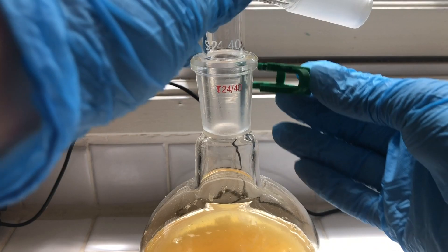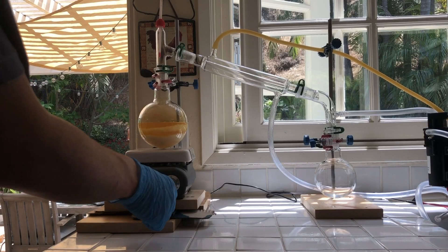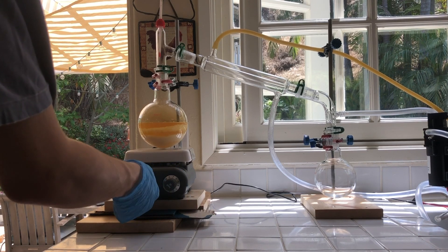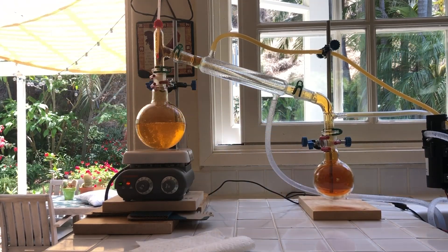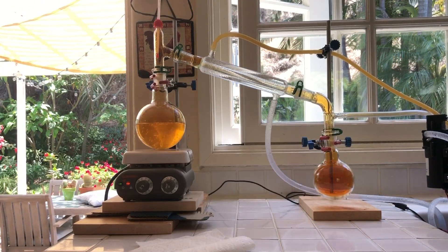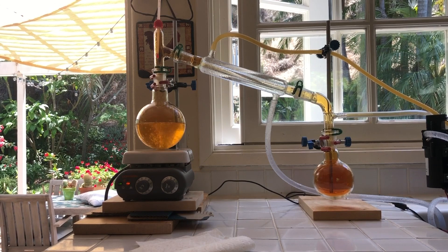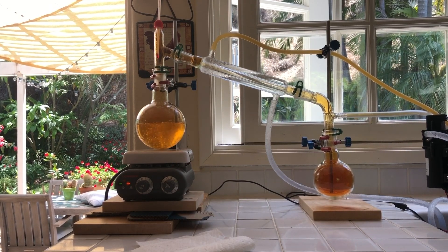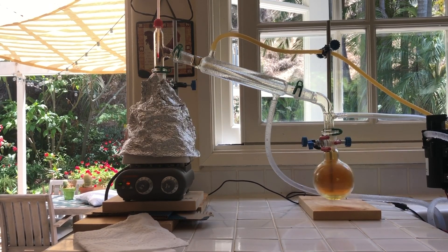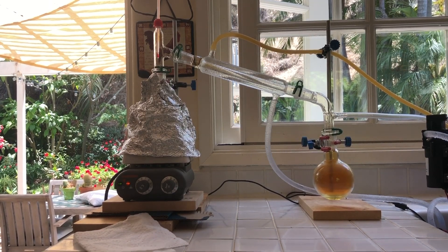Then I set up for simple distillation. I made sure to attach a hose that led outside, as a lot of nitrogen dioxide gas would be evolved during this reaction. Soon the whole apparatus was filled with brown nitrogen dioxide, which looked pretty cool. Additionally, the potassium nitrate had almost all dissolved, except for a little bit which I think were impurities in the low-grade stump remover powder. When distillate began being collected at about 110 degrees Celsius, the apparatus cleared up a bit.